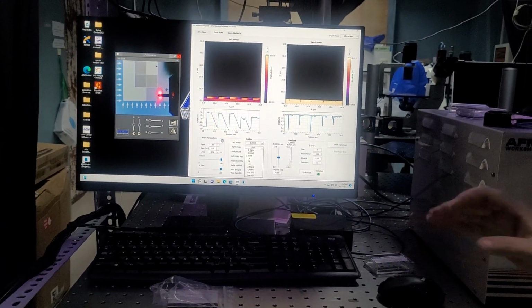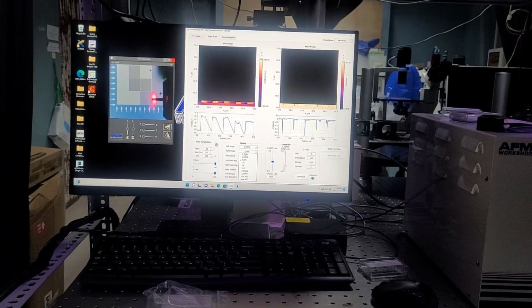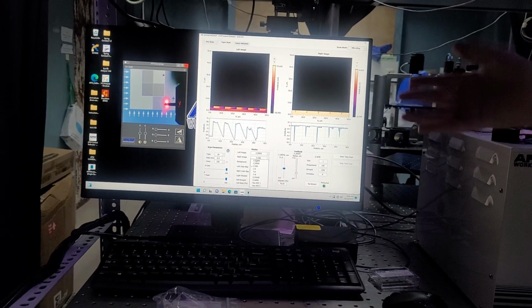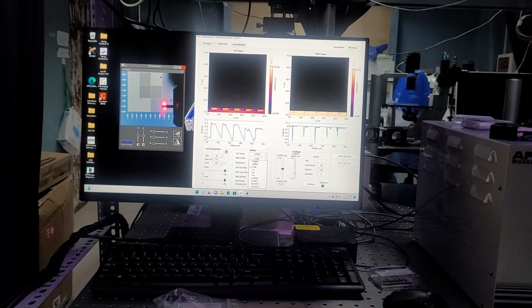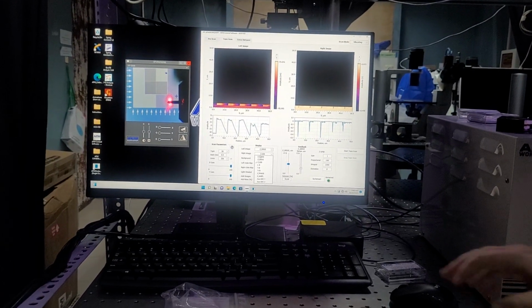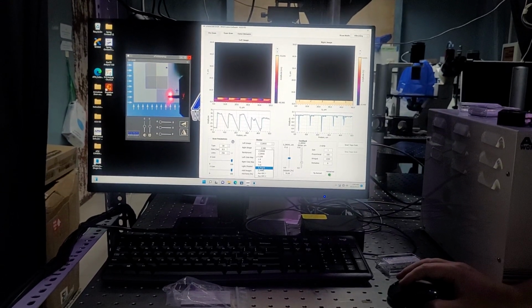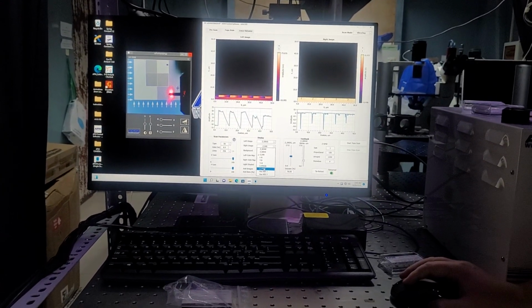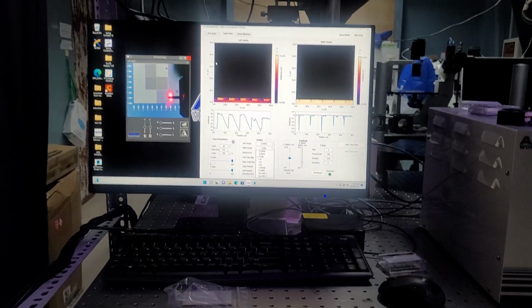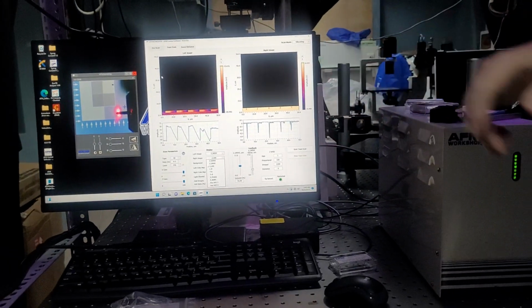Several of these have been things that were requested by customers that we've provided, and they've just kind of stayed in the software. So it could be a case where you'll never use it, or you could use it all the time. It just depends on the application and what use you find for them. Below that is Z phase. This is where you're able to look at your phase shift measurements. Z underscore ample will be a live readout of your vibrational amplitude. Realistically, it's going to look very similar to your error signal.